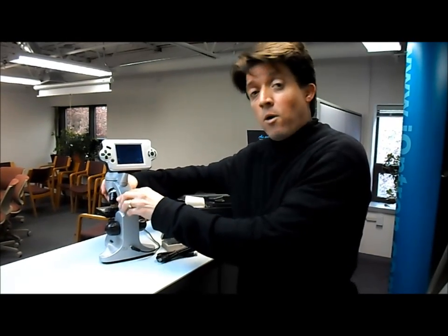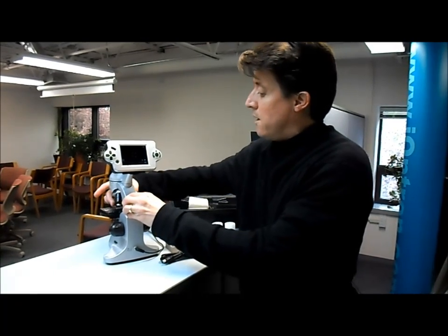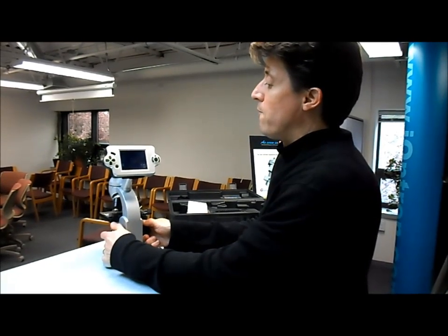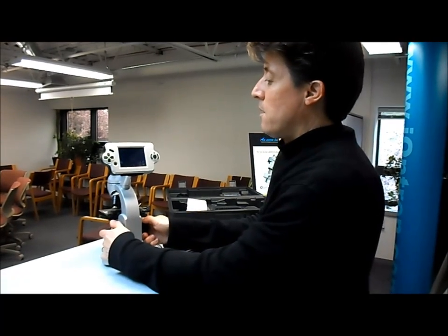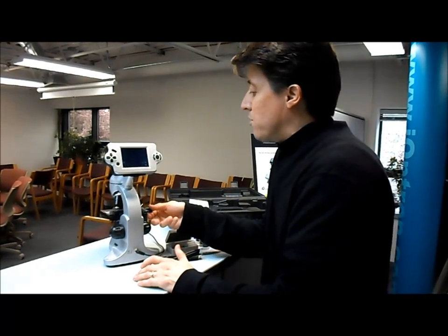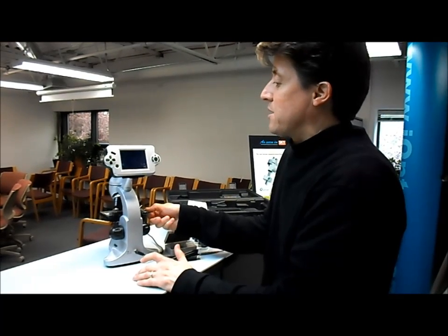I'm going to go from a 4x to a 10x to increase the magnification — I just move it with my hands, and it changes. I just have to refocus it because now it's closer. You can start to see the insides of the cell here; this is actually an onion skin cell, and I can use the XY axis to move it around.